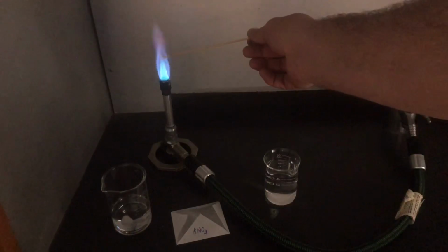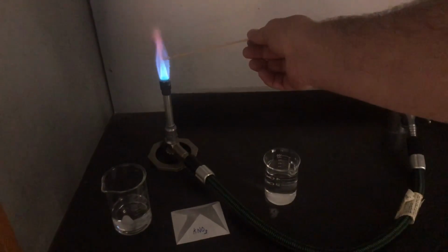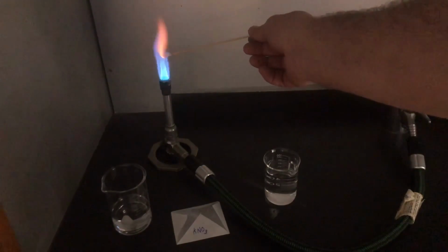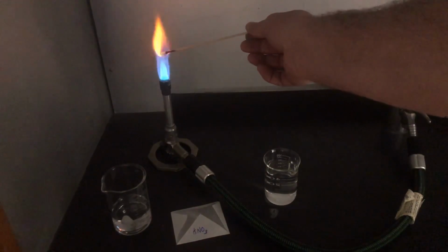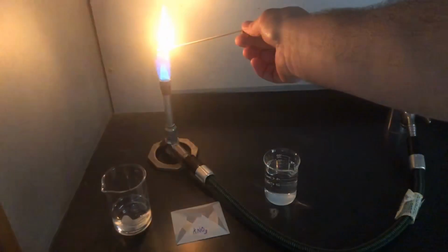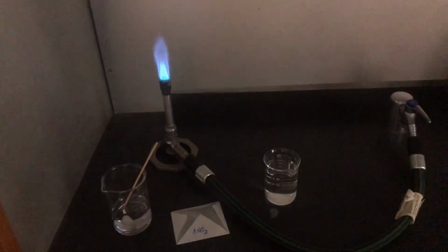But if this water evaporates and that cotton starts to burn, you're going to start seeing some of the carbon give off that yellow color. And of course, if we let that wood burn, a lot of carbon in there, you're going to get the distinct color of burning wood. And so we're going to put those out and we're going to leave them right there.